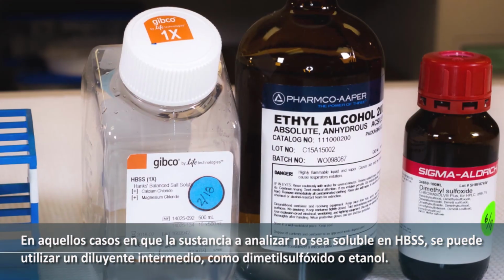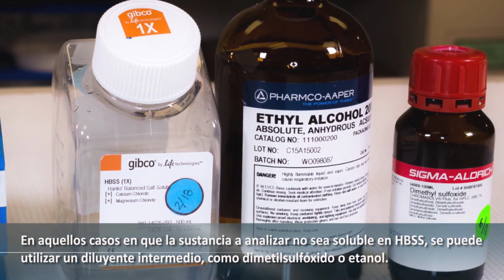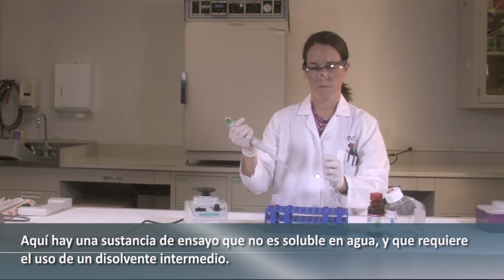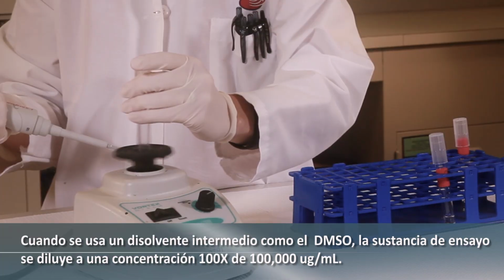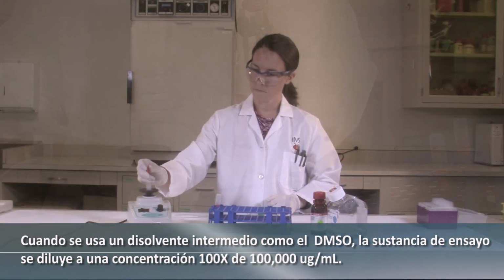In cases where the test substance is not soluble in HBSS, an intermediate solvent like dimethyl sulfoxide or ethanol may be used. Here is a test substance that is not aqueous soluble, requiring the use of an intermediate solvent. When using an intermediate solvent like DMSO, the test substance is diluted to a 100x concentration of 100,000 micrograms per milliliter.